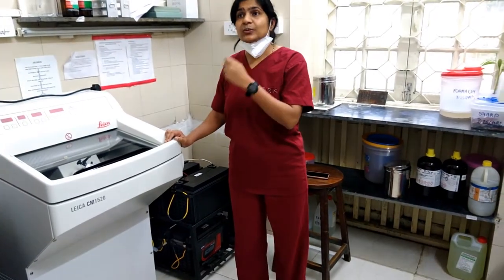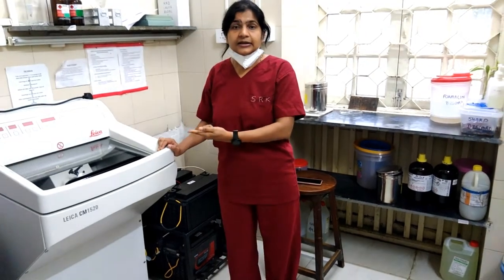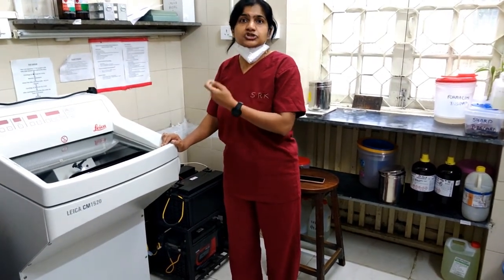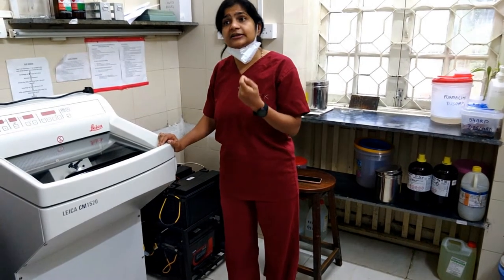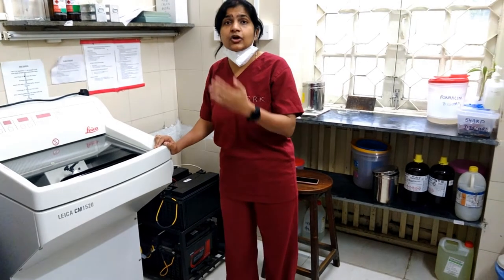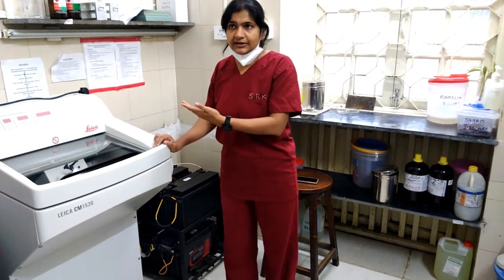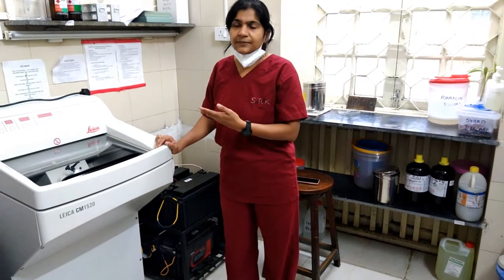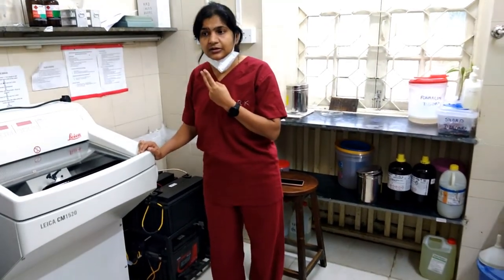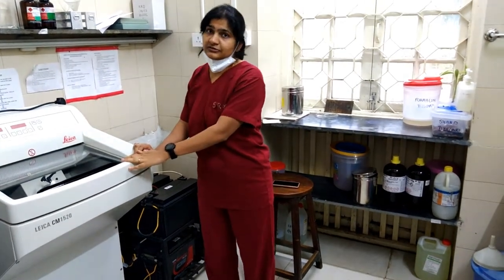But presently, because of this device, whenever a tumour is removed it comes down directly. Immediately, within 15 minutes, the nature of the tumour is communicated to the surgeon, and they then take the decision to remove the tumour completely or leave it. Whatever the further plan of management will be — be it chemo, radio, etc. — these two things, which were not available at Wadia, have been made possible with the help of this device.